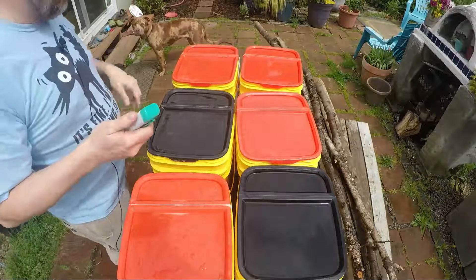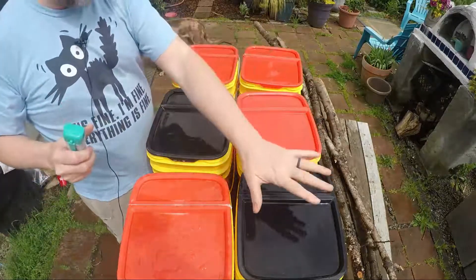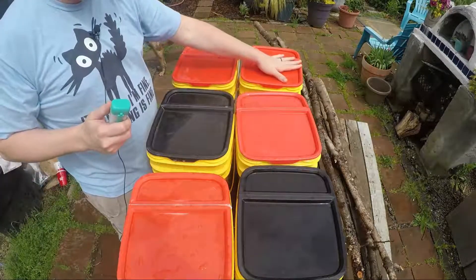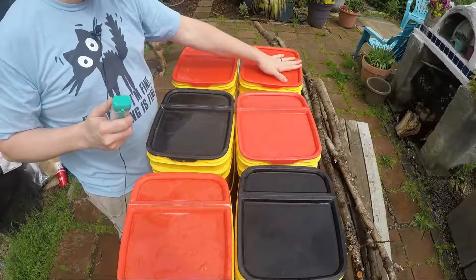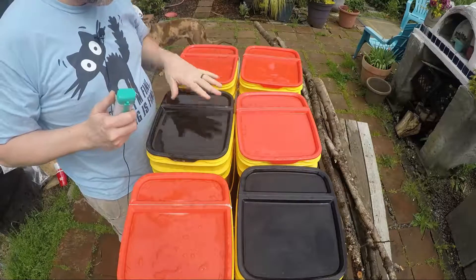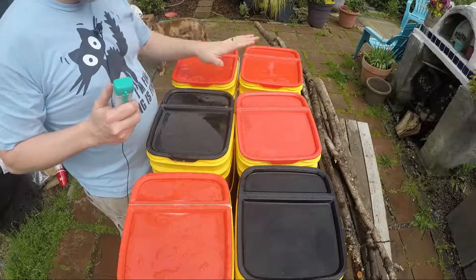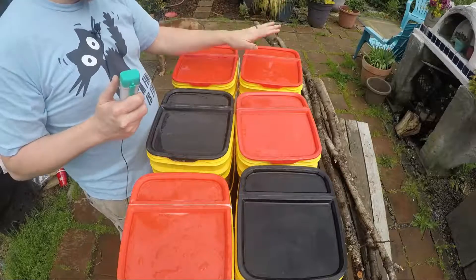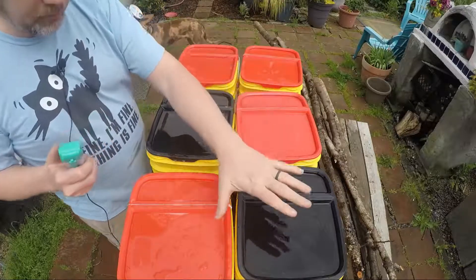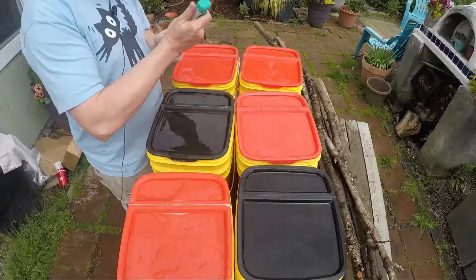We are one day later. We have the three tap waters reading at about seven point eight, the three rain waters reading about seven point five. We have still water, commercial lava rock, and bulk lava rock. Let's see where we're at today.